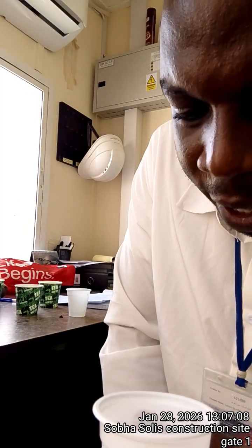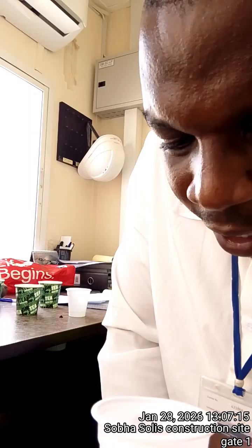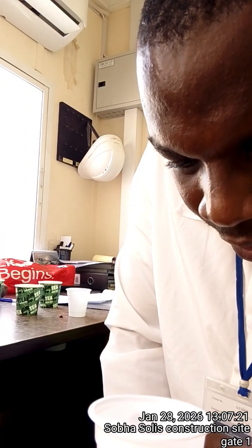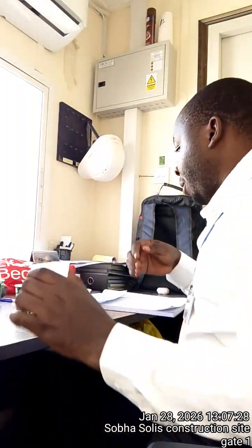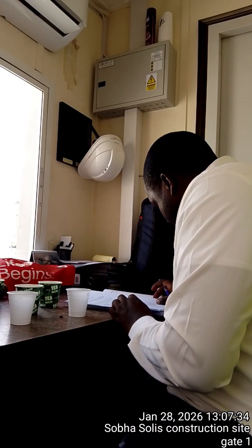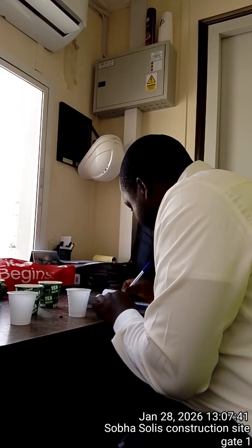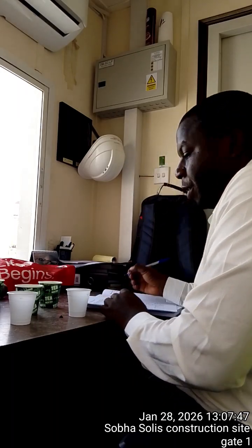What I'm seeing is very tiny bubbles, very small, and they are appearing at a minimal rate. Few amounts have shown up, very little. If you're not very keen, you cannot see anything. So my observation, I've seen some little bubbles, very small bubbles. This is what we call fizzing or effervescence.